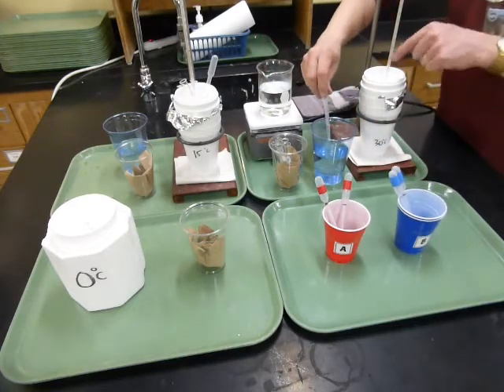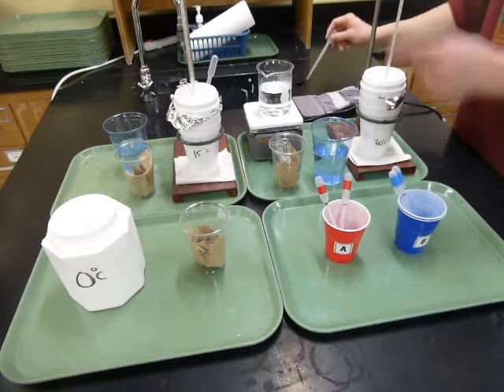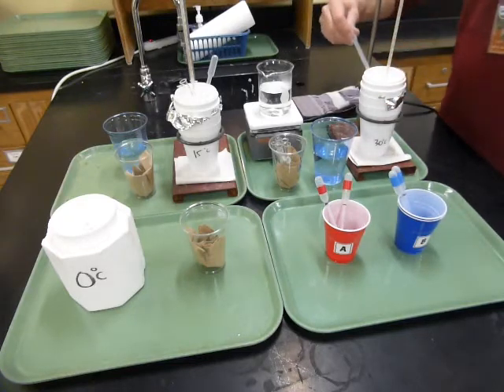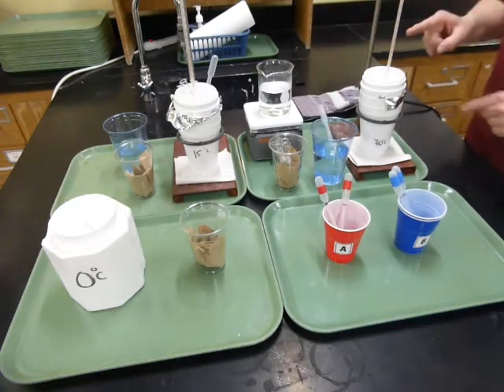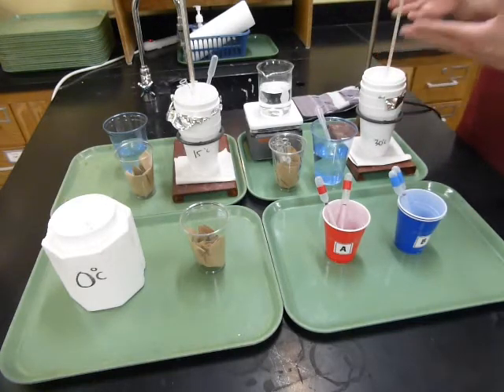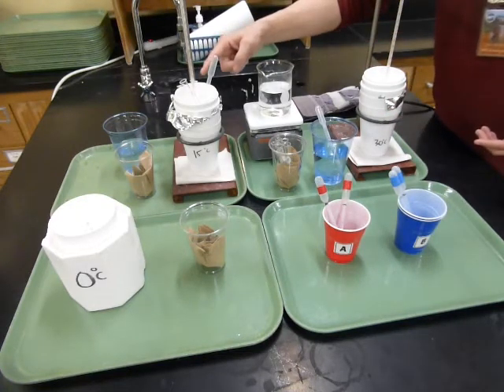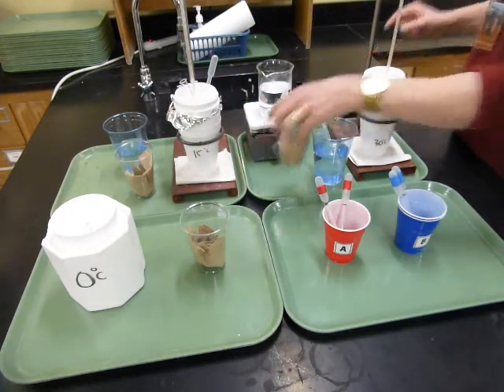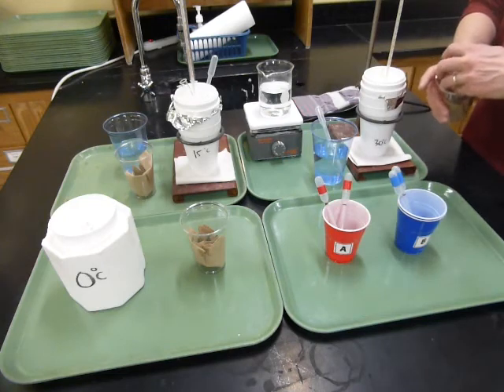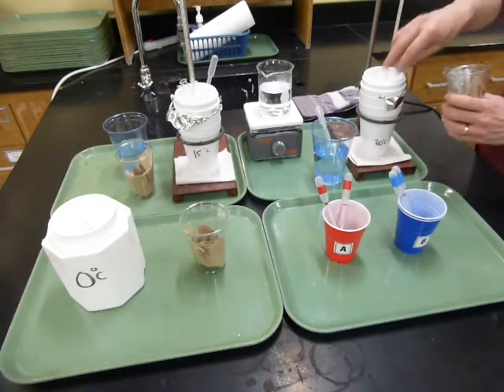Now, if the water level in here gets to be too much, you can take some out using a squeezy pipette and just put that in the sink, because when you put the test tubes in there, the water level is going to go up and you don't want it to overflow. So keep the temperature constant. Someone's got to keep their eye on this all the time, because while it's sitting there, it's going to cool off. So someone's got to keep making sure that this stays at 30 degrees. Someone keeps that one at 15 degrees. That one stays at 0 degrees all the time by definition. Once this is at 30 degrees and you've got all the tubes made with the A and B solutions, these go in here as well.